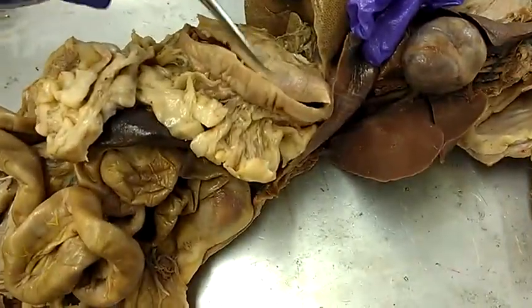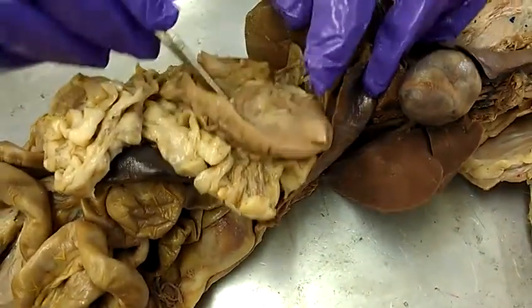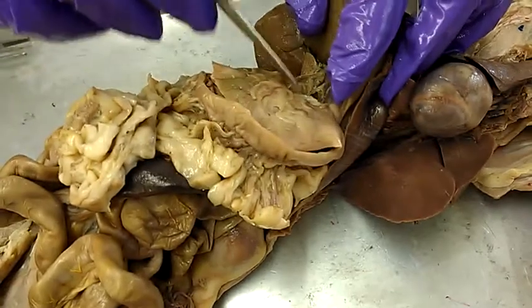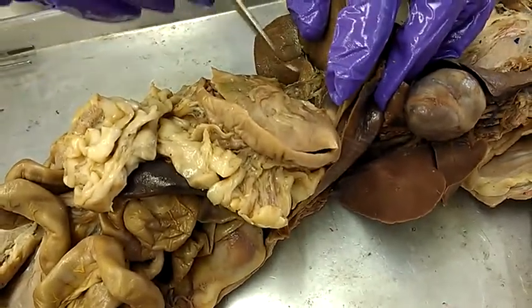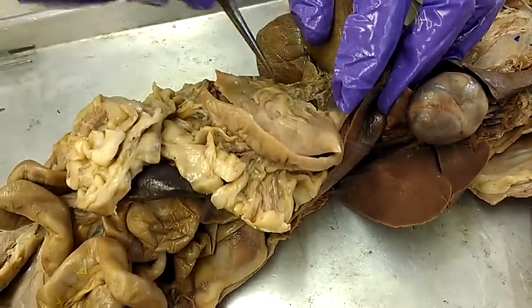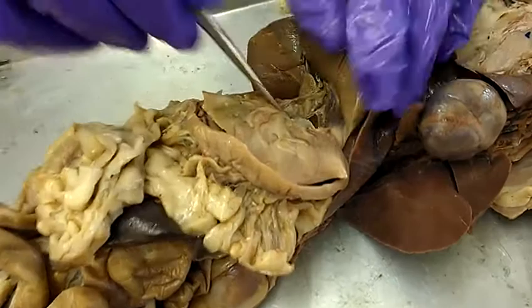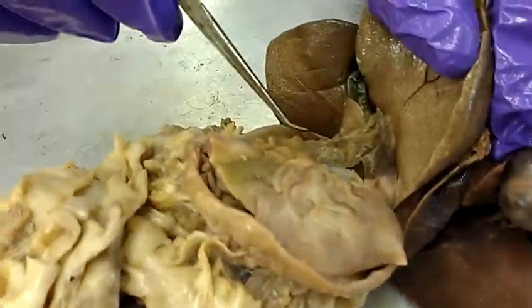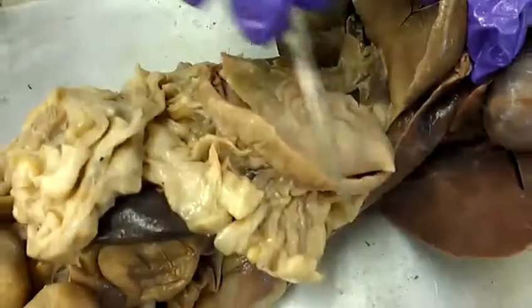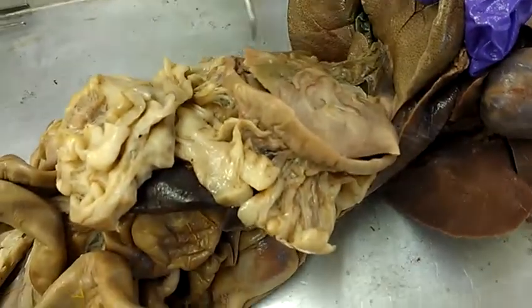What is this? The stomach. That's the body of the stomach. So this is the lesser curvature, and this is the greater curvature.